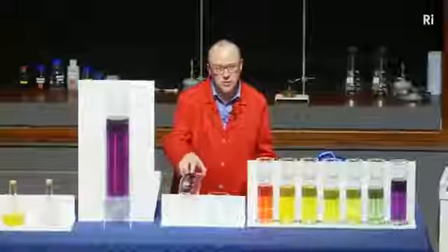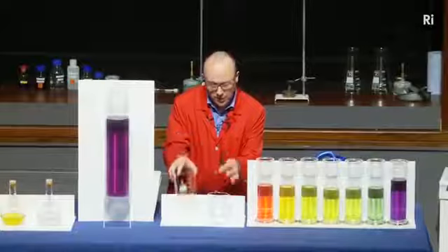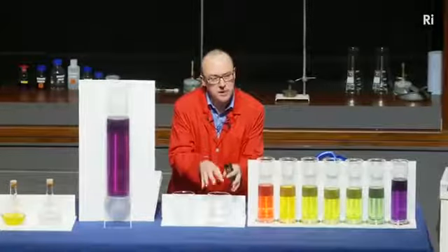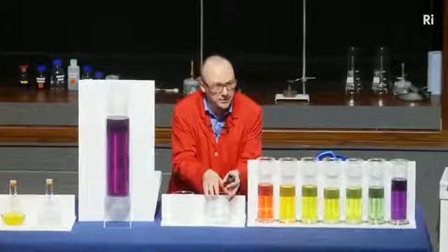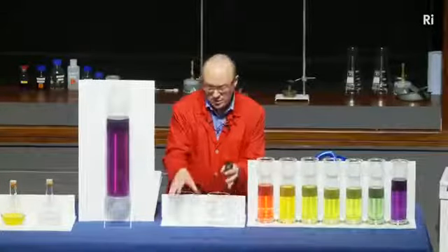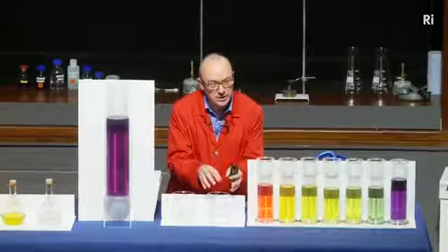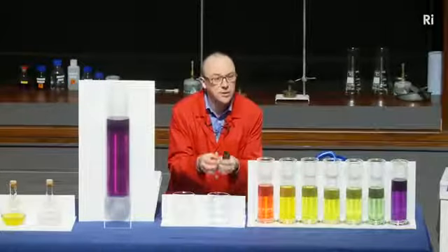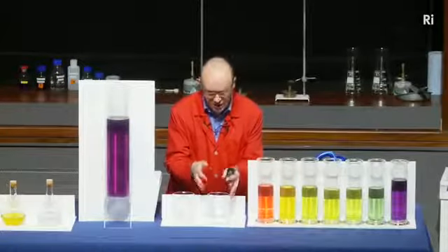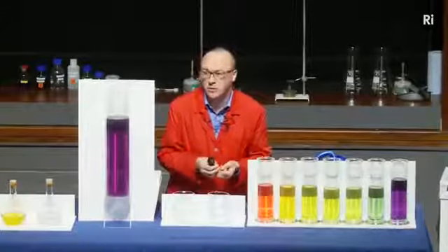So as I started to pour the liquid, the acid and thymolphthalein from here went into the alkali, but the alkali quickly cancelled out the acid, so the thymolphthalein is now in an alkaline solution and it turns blue. But as I keep on pouring, I'm adding more and more acid, it's neutralising the alkali, and eventually this beaker becomes acid as well, and the thymolphthalein goes back to being colourless. So this reaction was not going backwards, it was just the same reaction all along.